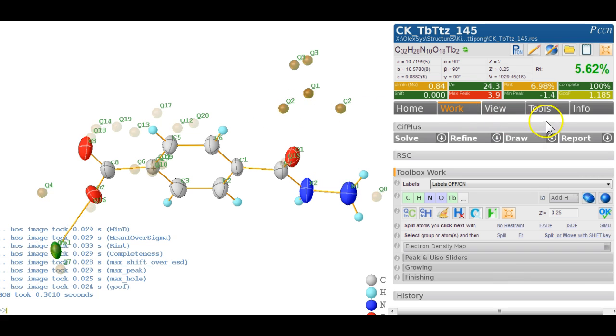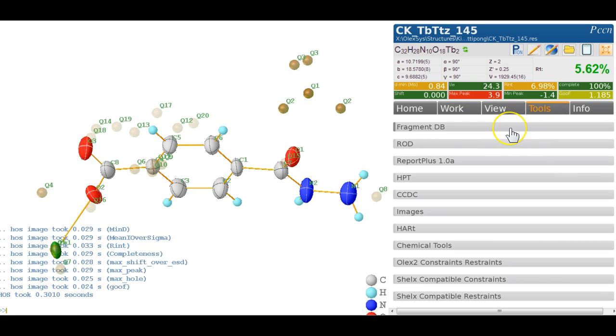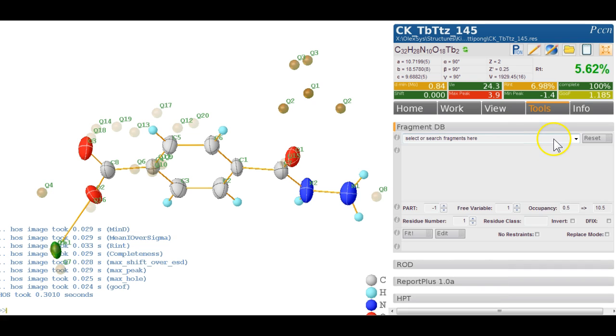My suggestion would be to use the FragmentDB tool. I'm going to search for a nitrate. So I type nitrate, I hit return. There's the anion. Because there are some symmetry generated atoms, we want to be a negative part, so we get part -1. Free variable, we ignore occupancy 0.5 because it's part -1, and we just simply fit that.